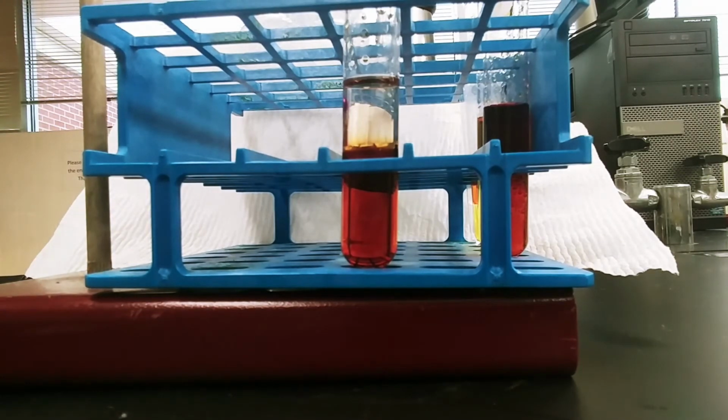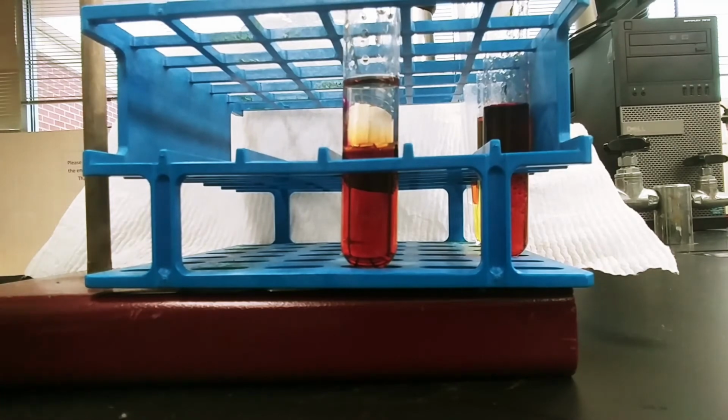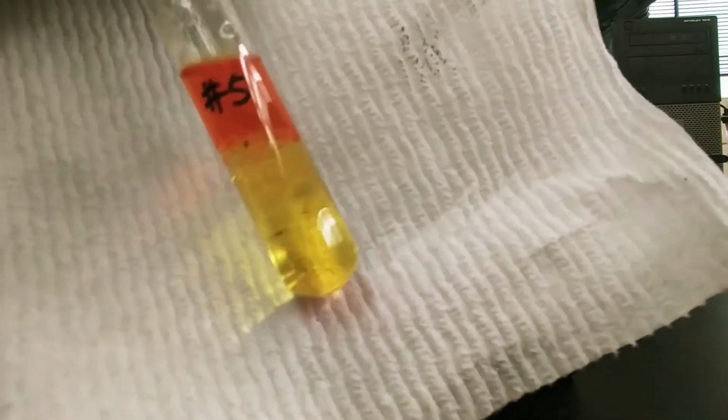We have to think about, if a reaction takes place, what will be the neutral halogen in solution? If a reaction does not take place, then the original halogen we put in is going to be in solution. The way we tell, again, is by seeing what halogen goes into our cyclohexane layer. So, here we go, test tube number 5, where we've added bromine water to our sodium chloride.